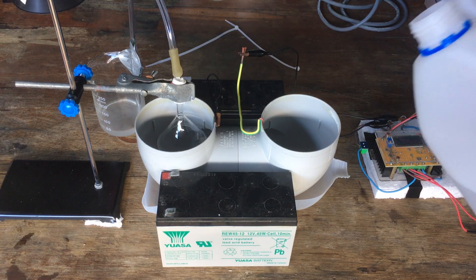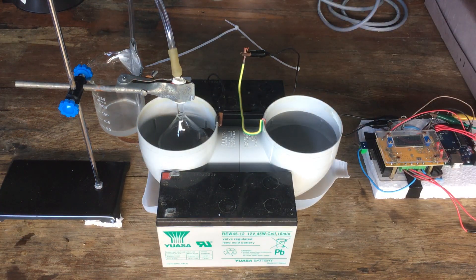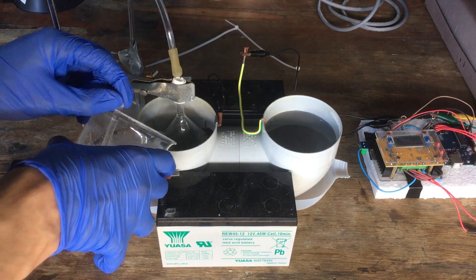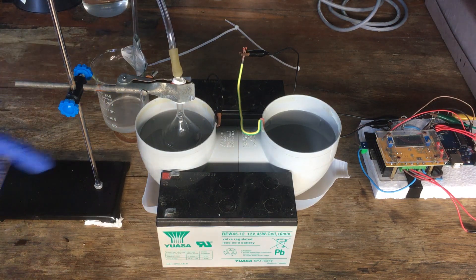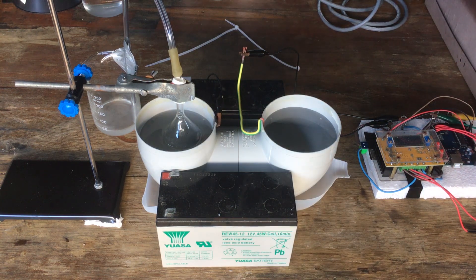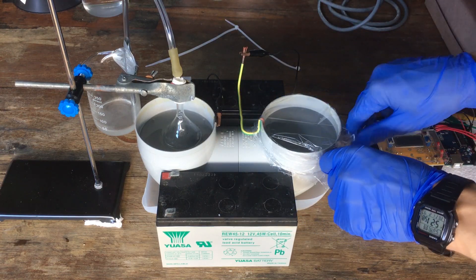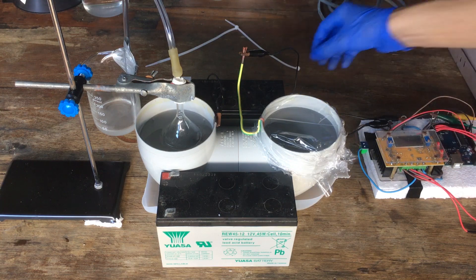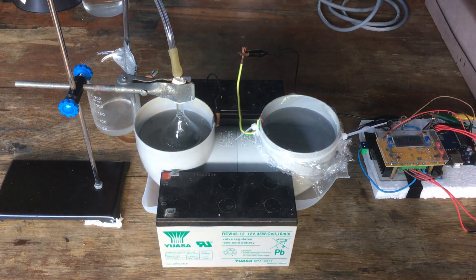Alright, everything's wired up. Only thing left to do is add our catholyte, which is initially just distilled water, and then our anolyte, which is a saturated solution of potassium chloride with a bunch of excess salt in there as well. You'll notice that I also have a beaker with a little bit of sodium hydroxide solution in it that will catch all of the chlorine that comes off the anode. See, we're collecting it in that inverted funnel, and then through that tubing into our gas scrubber. We put a small piece of cling wrap over the cathode chamber there, making sure not to make it completely airtight because we need hydrogen to escape, but this will stop carbon dioxide from getting in and reacting with our potassium hydroxide as we form it. It'll also stop any dust or insects from getting in too. And with that, we're ready to turn everything on, so let's go.